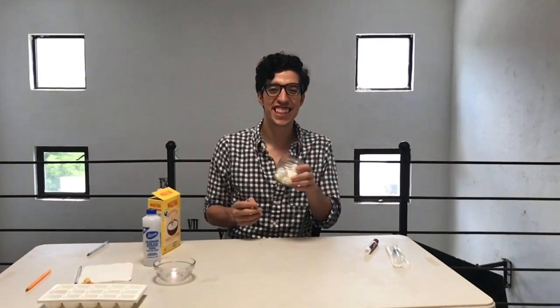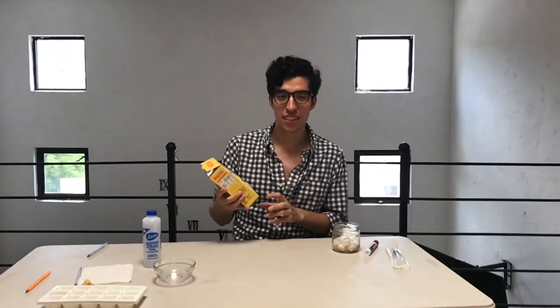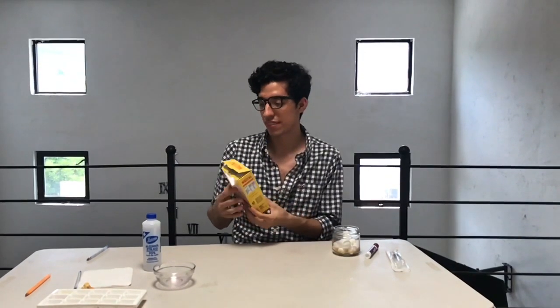Cotton. Oh, where's the cotton? Cotton and cornstarch. This will help to separate and do the chromatography. Also, it's recommendable to use an air pump or something like that to give us energy for the separation. And I almost forgot the colorant, that is the thing.